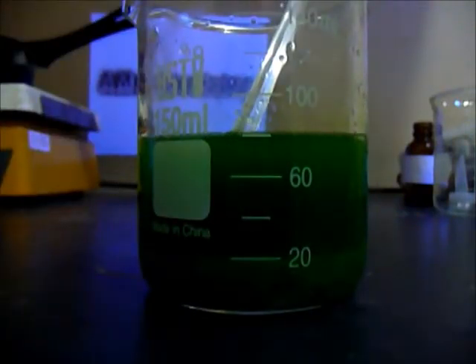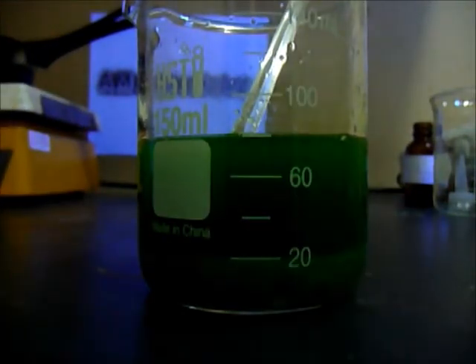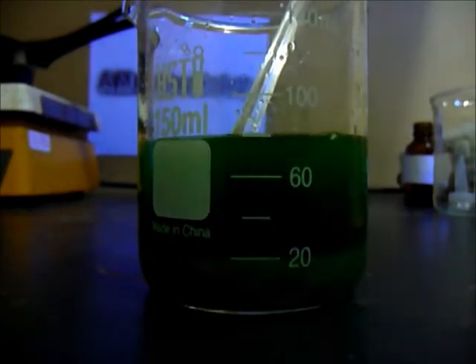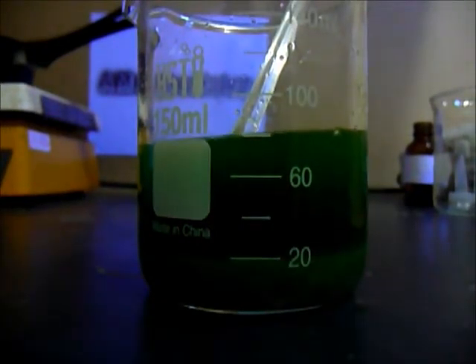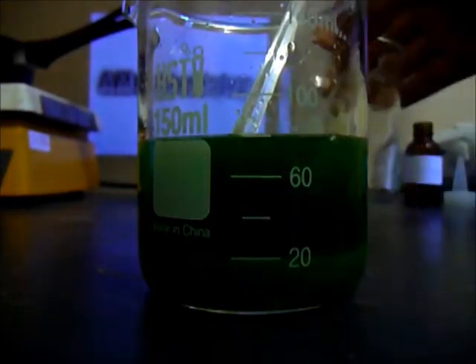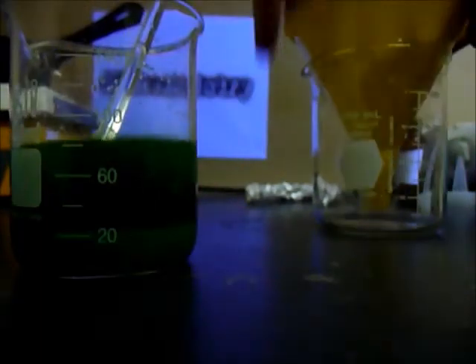Okay, and now the next step is to filter it. So, just get a funnel and filter paper, which I'm getting right now. Just fold the paper and you can pour it in here.